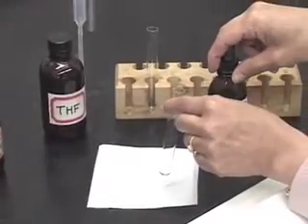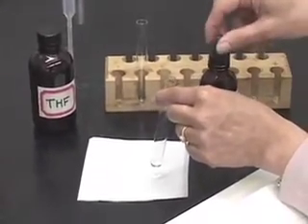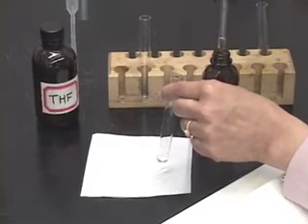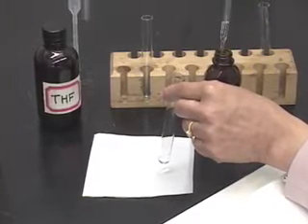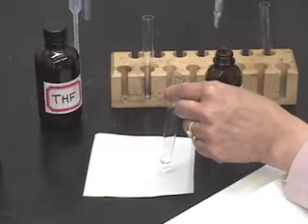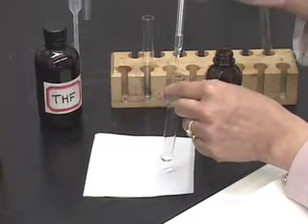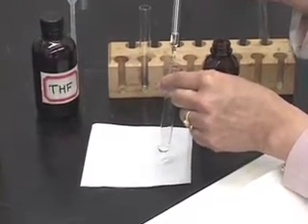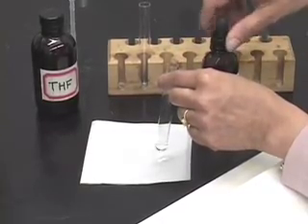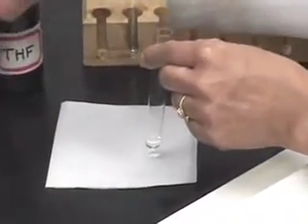Let us test cyclohexene first. As the name indicates, cyclohexene has a double bond. So let us see what the result will be for a compound that has a double bond in it. So two drops of cyclohexene. Mix the two.